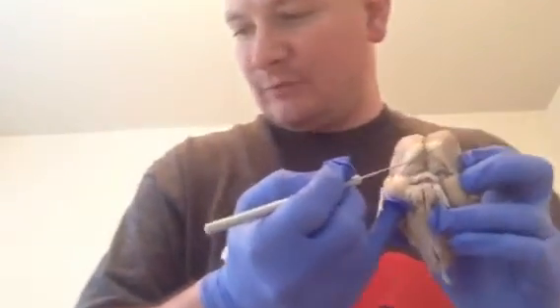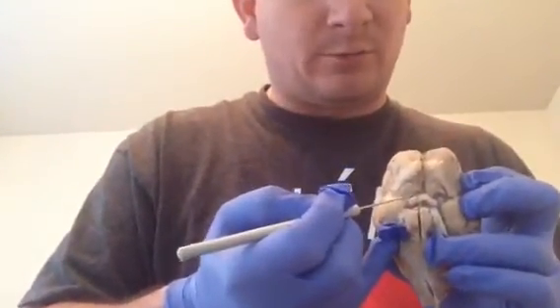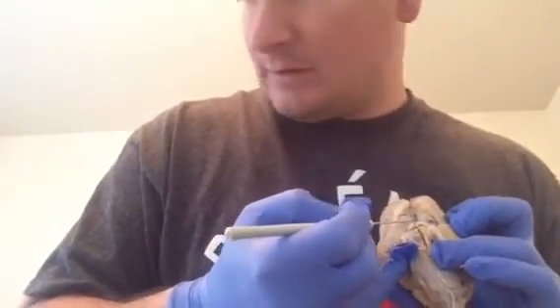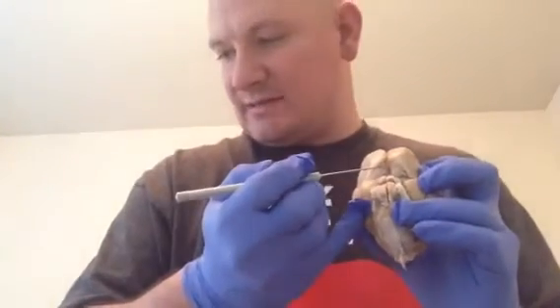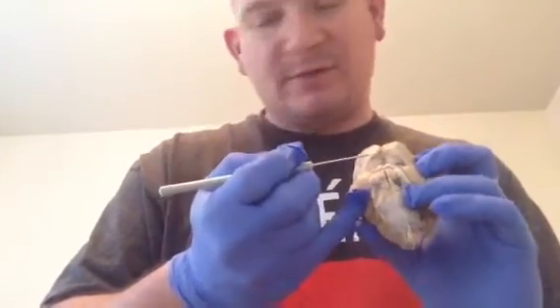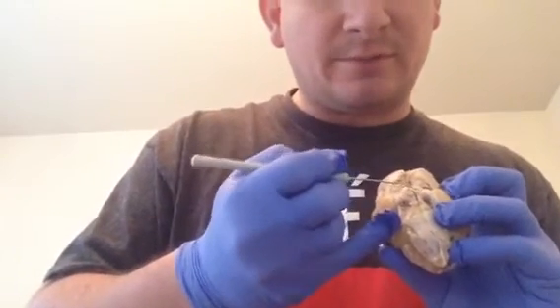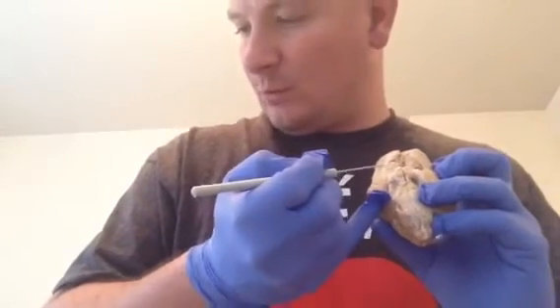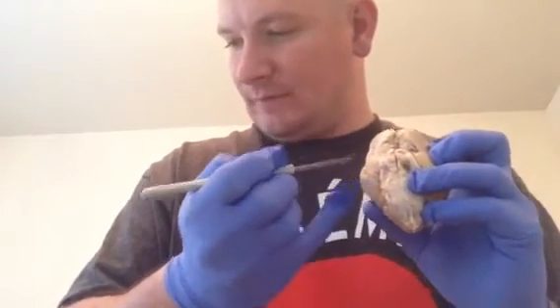cranial nerve 1. Cranial nerve 3 and the oculomotor portions are even further in, and those control the motion of the eyes itself. The trochlear is not visible at this time. The trigeminal comes over what I think is the pons section here, very well displayed. And the abducens are not visible at this time.